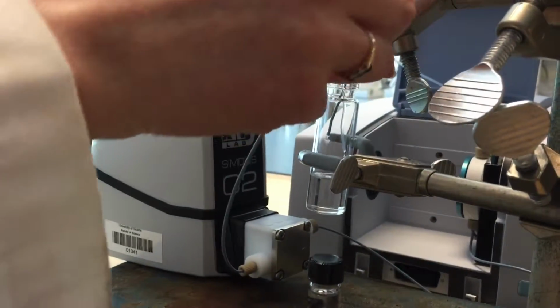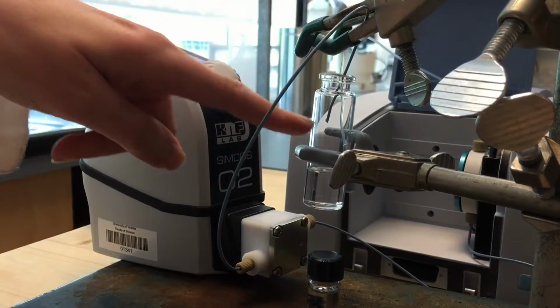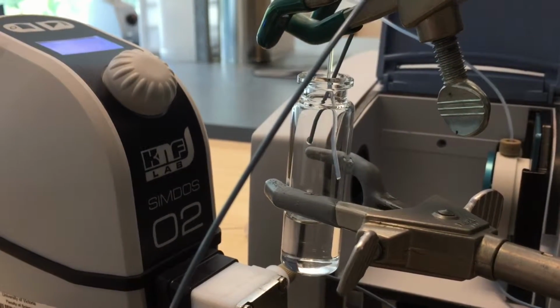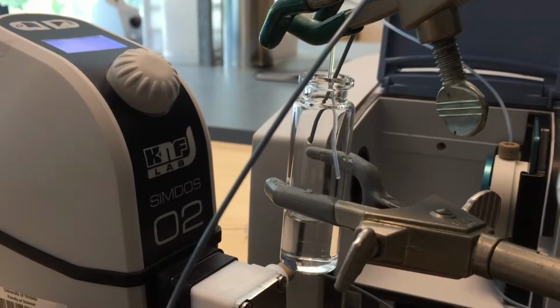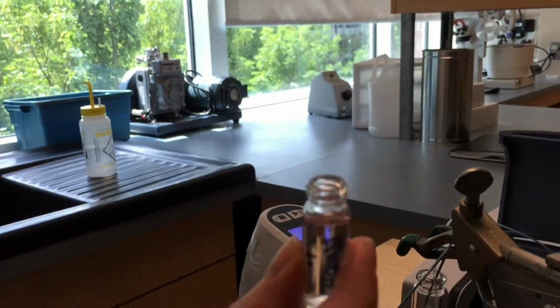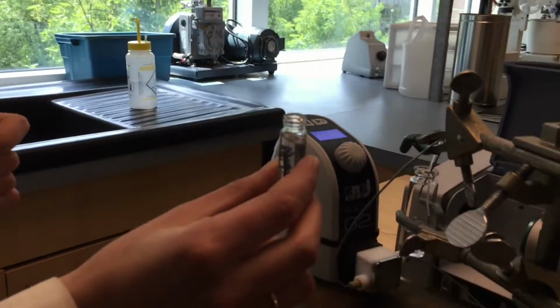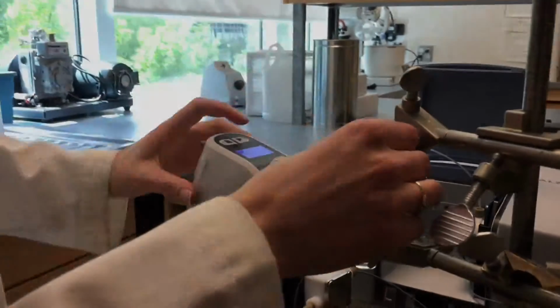This is the inlet valve, this is the tubing that goes into the flow cell, so I'm taking that out of solution. And solution is still coming out of the outlet from the flow cell because we're emptying it. Soon you're just going to see air bubbles come out. It's already sputtering, so most of the air is left. When that's ready, we're going to switch to our solution here, which has some methanol in it. Methanol and DCM, so hopefully we'll see a nice broad alcohol stretch. Okay, so that looks about done.